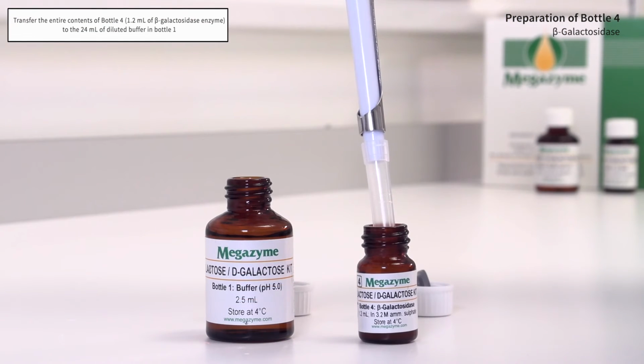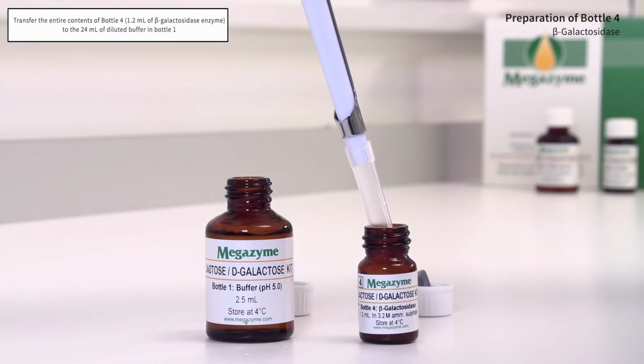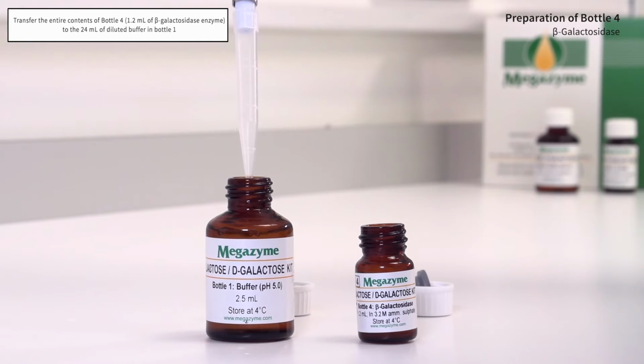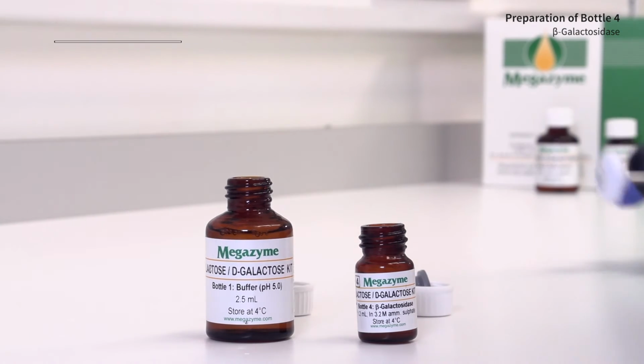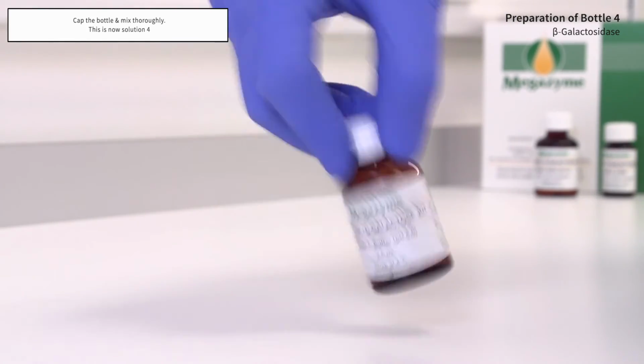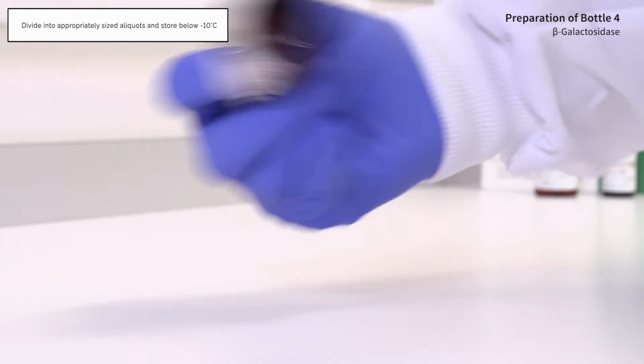Transfer the entire contents of bottle 4, 1.2 ml of beta-galactosidase enzyme, to the 24 ml of diluted buffer in bottle 1. Cap the bottle and mix thoroughly. This is now solution 4. Divide into appropriately sized aliquots and store below -10 degrees Celsius.